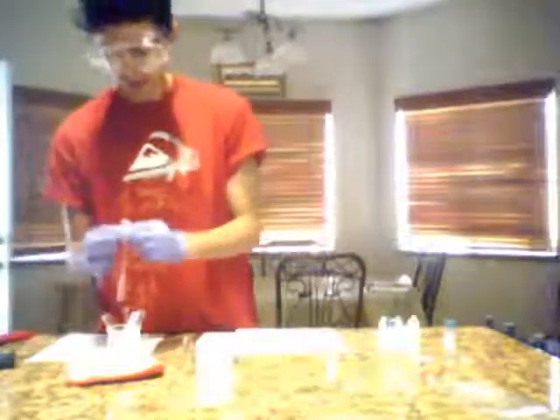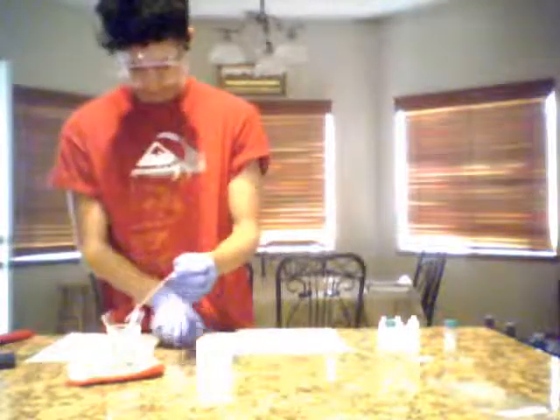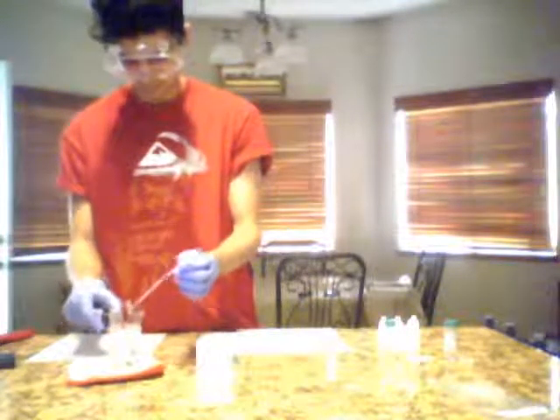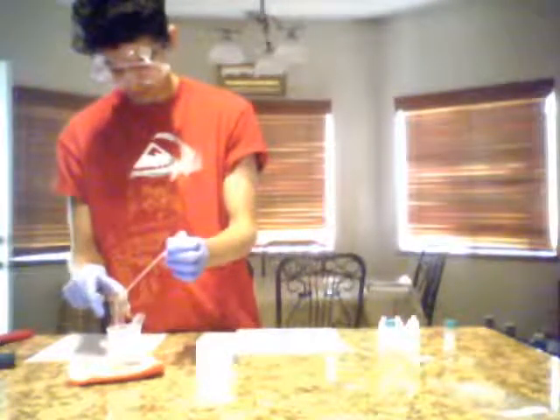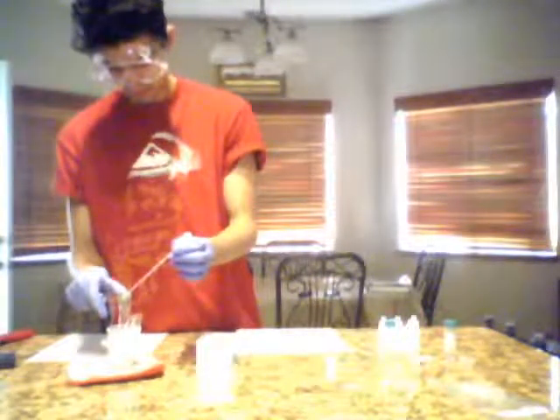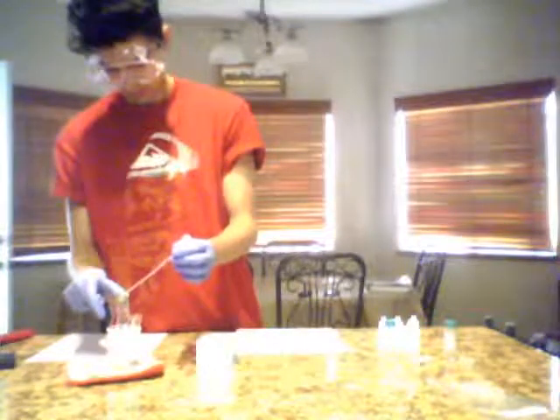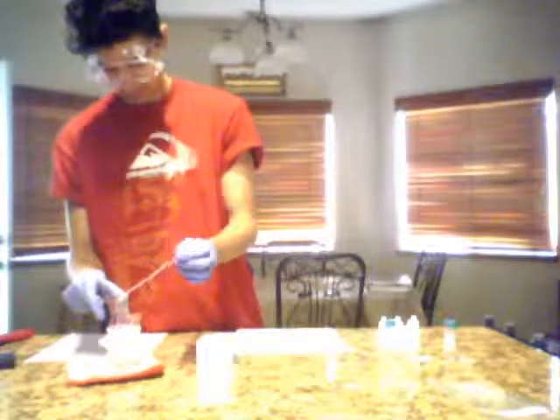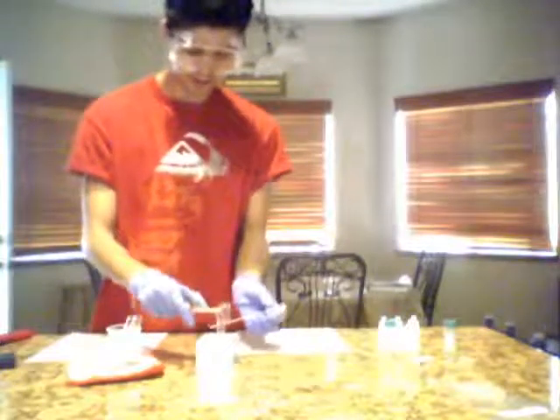So we're going to grab our pipette. We're going to go ahead and move it over here.